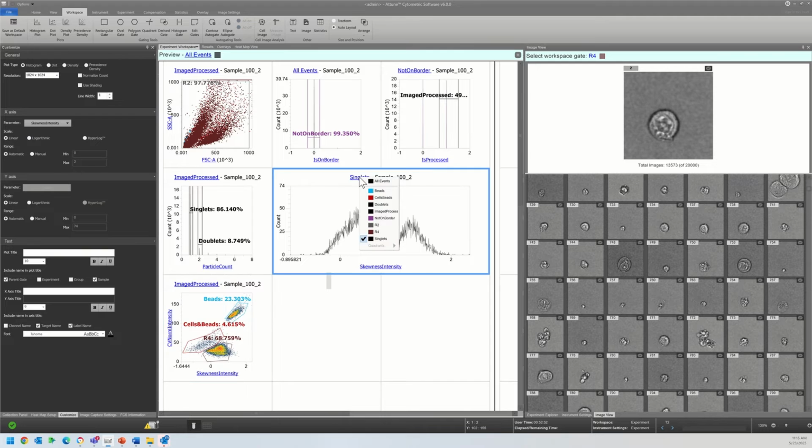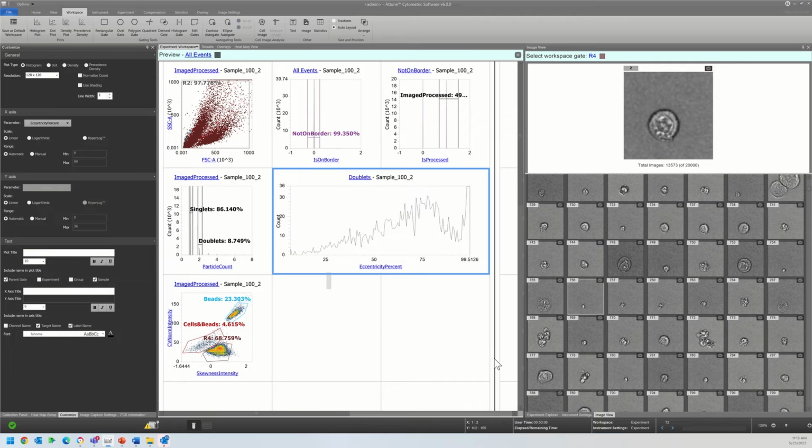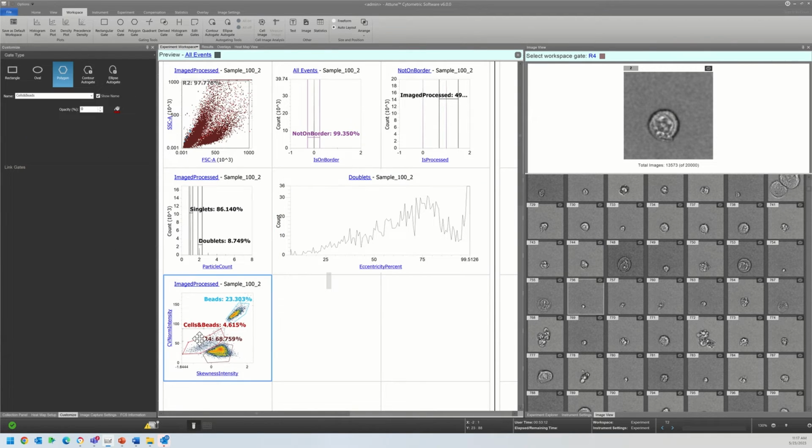I'm actually going to switch to the doublet gate. And let me change that resolution. The reason I'm doing that is because I want to demonstrate a way to use a particular feature, eccentricity percent, to potentially call out some of these events that are coincidental. So there's simply two of them imaged in the same field versus actually interacting. And eccentricity is a really helpful way to do that.